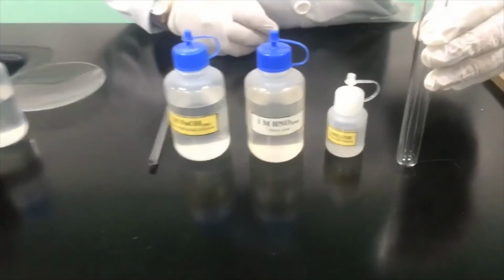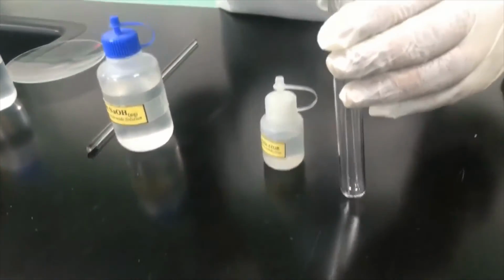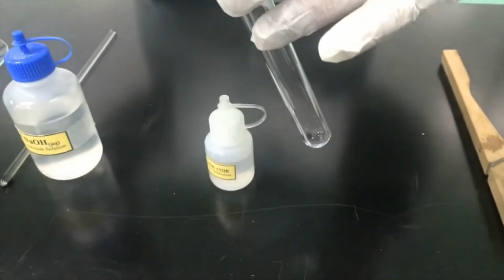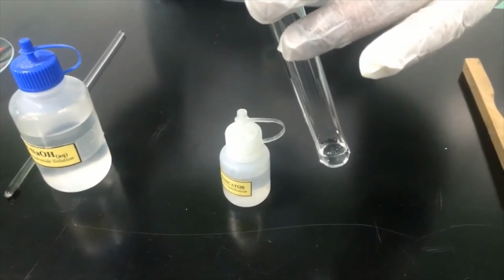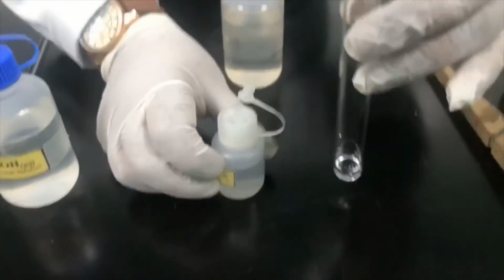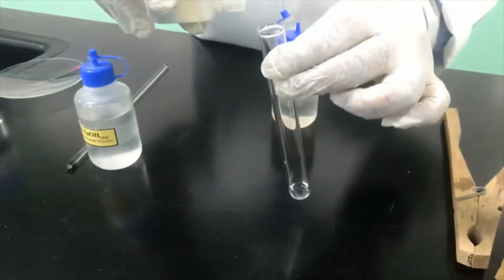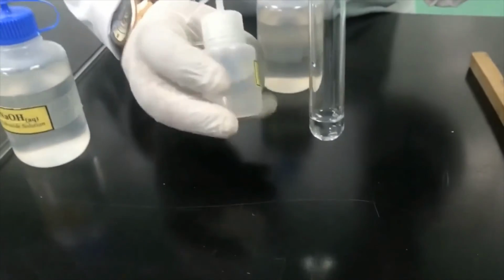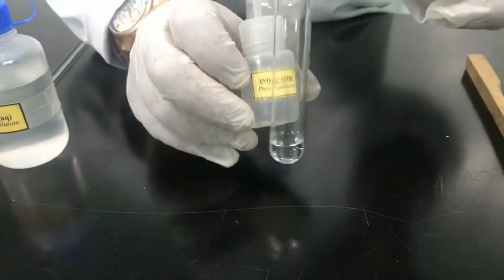Okay, here I have the test tube, in which I'm going to add the nitric acid. You can see it's a colorless solution. Now, the next step, I will add the phenolphthalein indicator, just 1 drop enough for this reaction. So just 1 drop, I'm adding it. You can see that it does not produce any color. So we can conclude the phenolphthalein indicator is colorless in the acid.